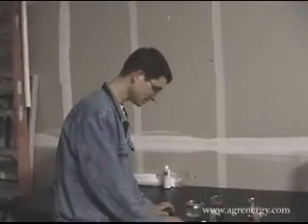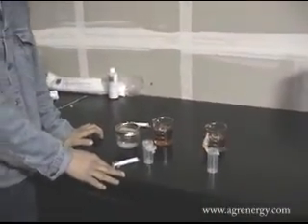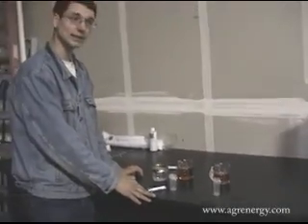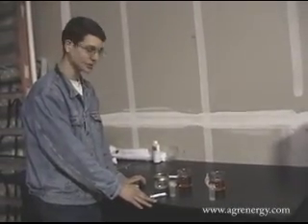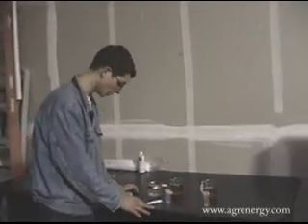So here we're going to do a demonstration of what's known as the 27-3 test. This test is basically to determine if a sample of biodiesel is likely to meet ASTM standards for free and total glycerin, which basically measures how complete the reaction was.